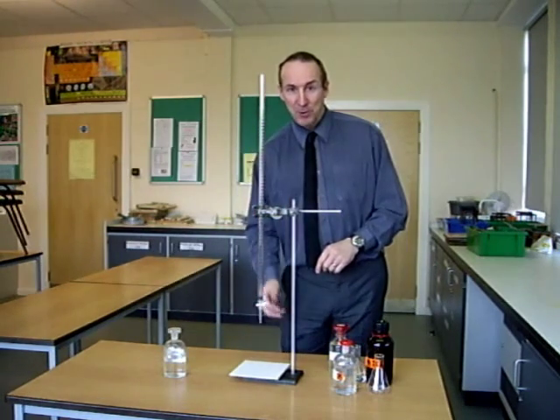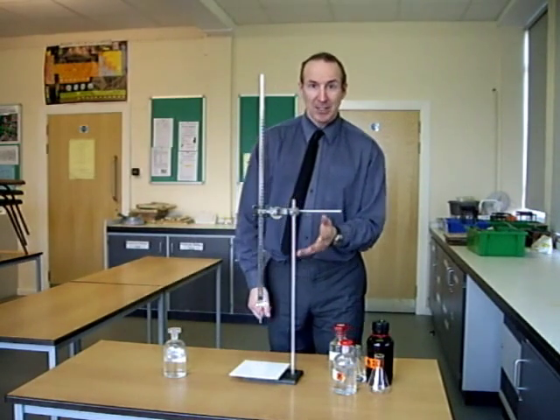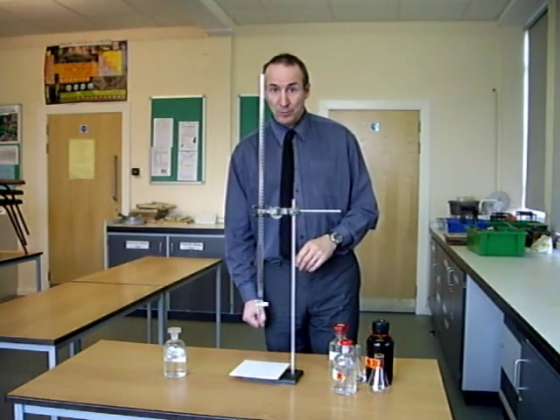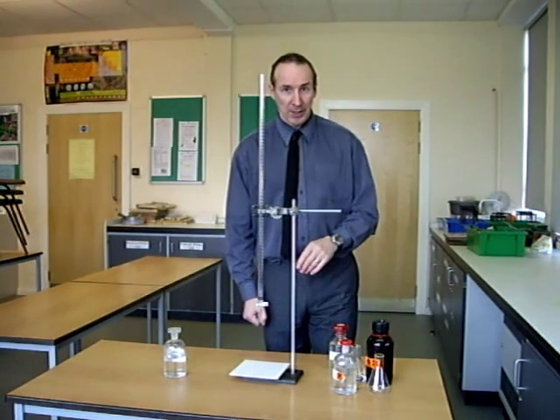I'm going to go through titrations with you. Titrations and the calculations related to them are something that students find tricky, both at GCSE and at A-level. So, chemical titration, I'll work through one and we'll go through the calculation at the same time.